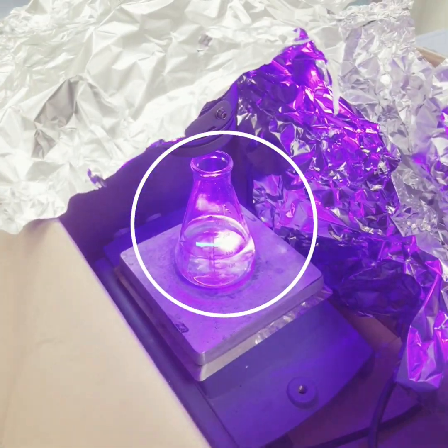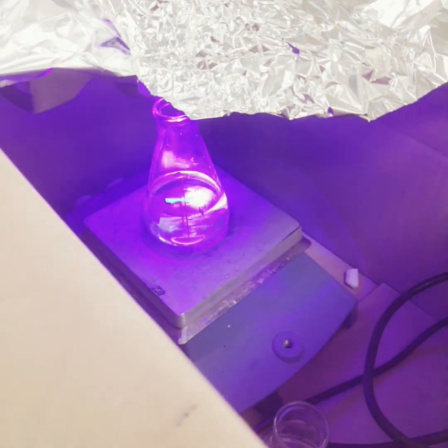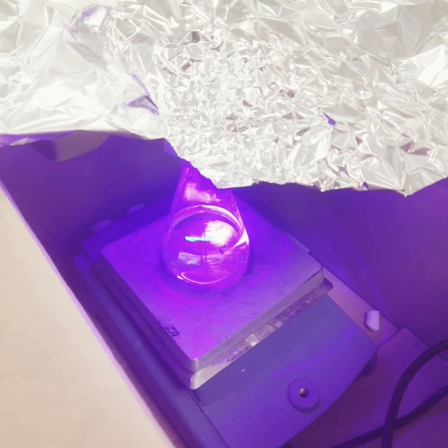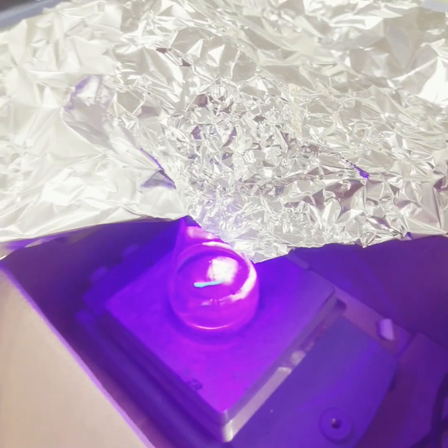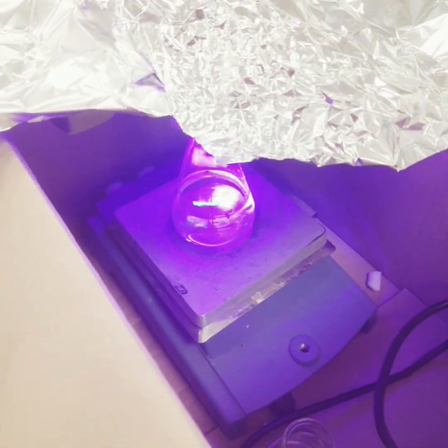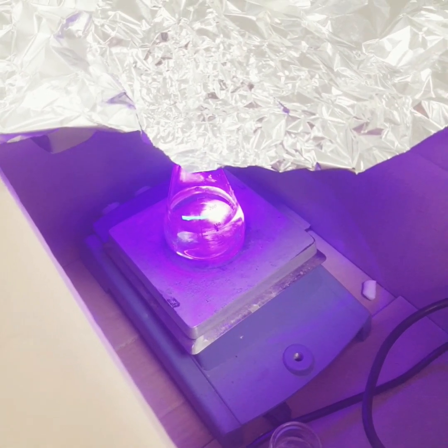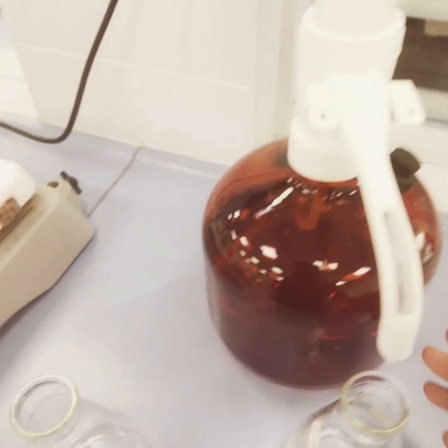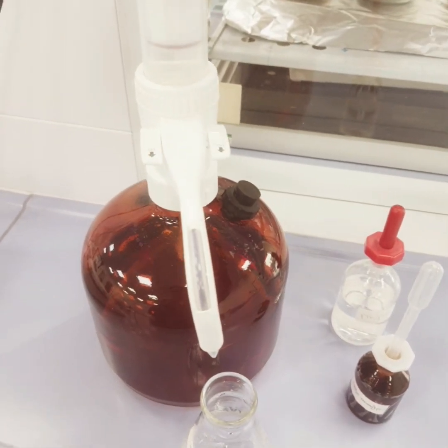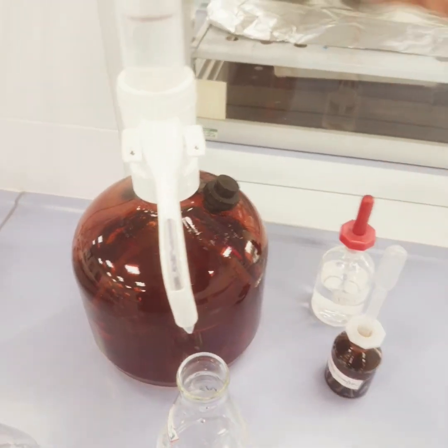Then we will soak this in 0.1 molar HCl. After irradiating, you can even add beads and shake, so that whatever drug solution has adsorbed on the pores of the membrane will be released, and your pores are again available for adsorption of the pollutant. Now we will wash this with the help of 0.1 molar HCl.